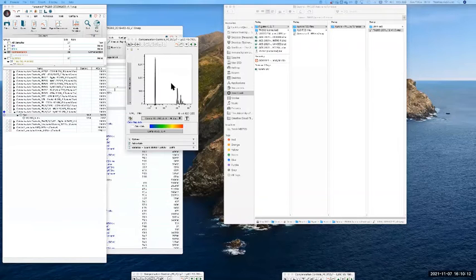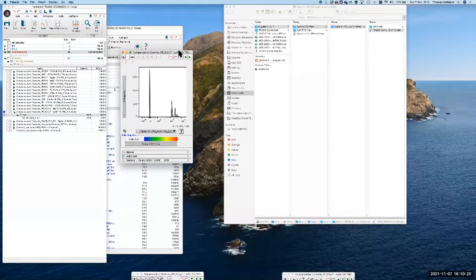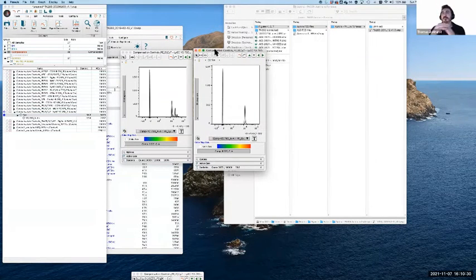Have you guys ever had that problem, and do you know what causes that sort of two peaks in the positives? You mean like this kind of thing? Yeah, that's beads. Yeah, that looks like beads. Is that just on singlets? Well, this one is on the doublets. Even sometimes when you gate singlets, you see these two positives. Ah, interesting. Okay. I don't know. Have you guys ever encountered that?